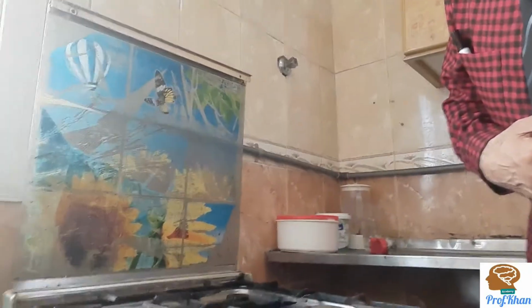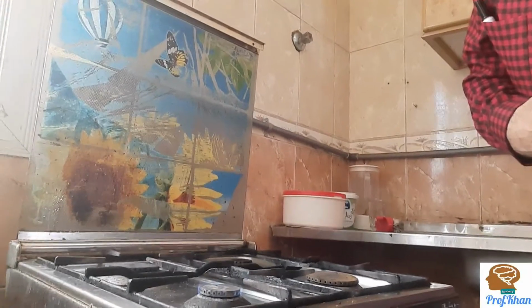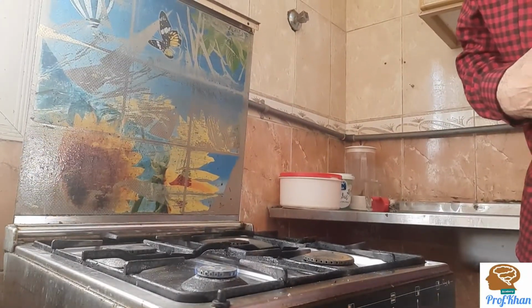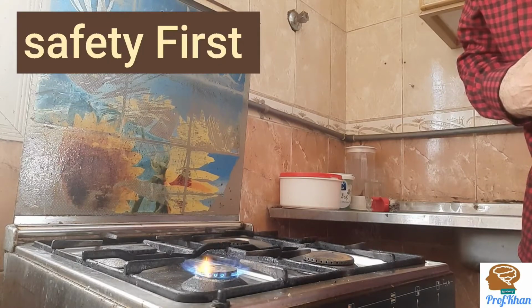I'm just shifting my camera near the heat source, right? So here I'm going to place the camera such that you can see the source. Here we have a source of heat. You can see the flame.